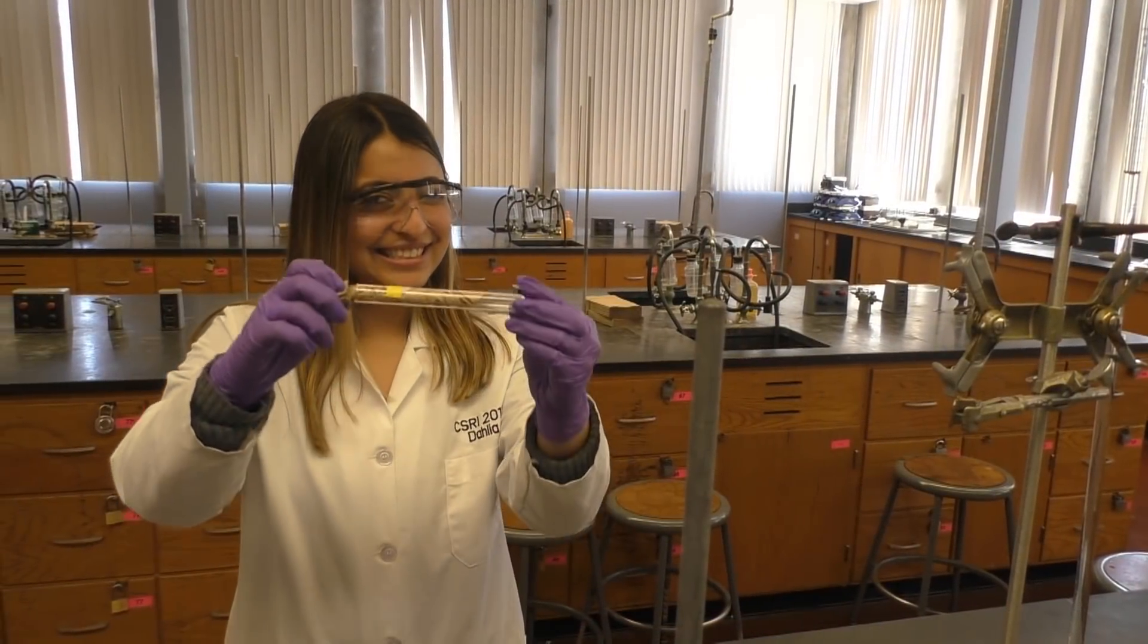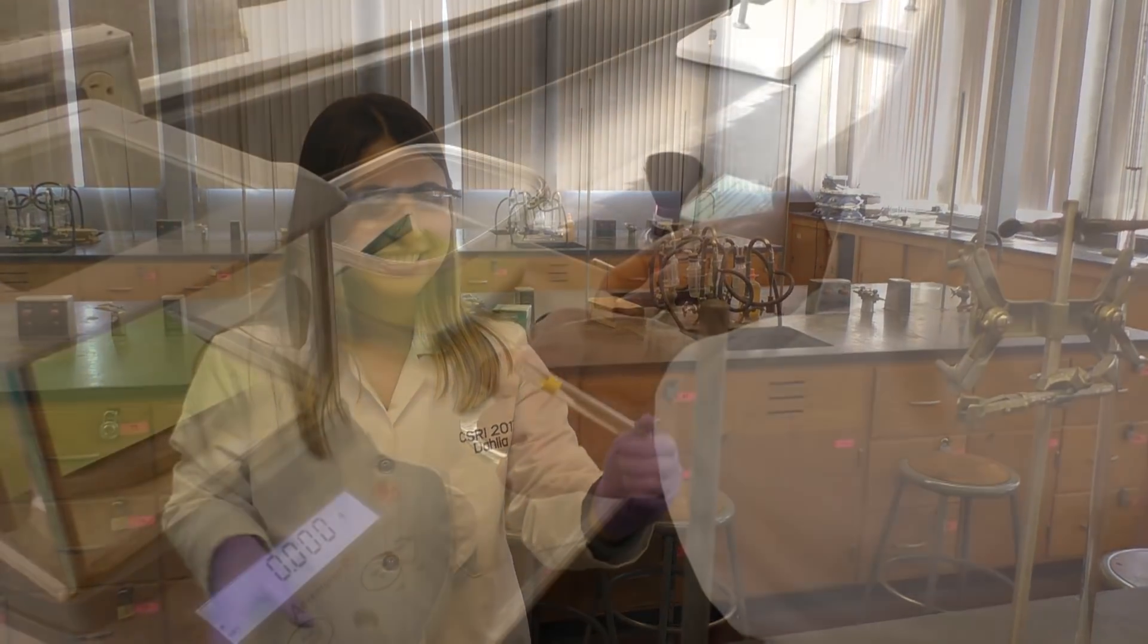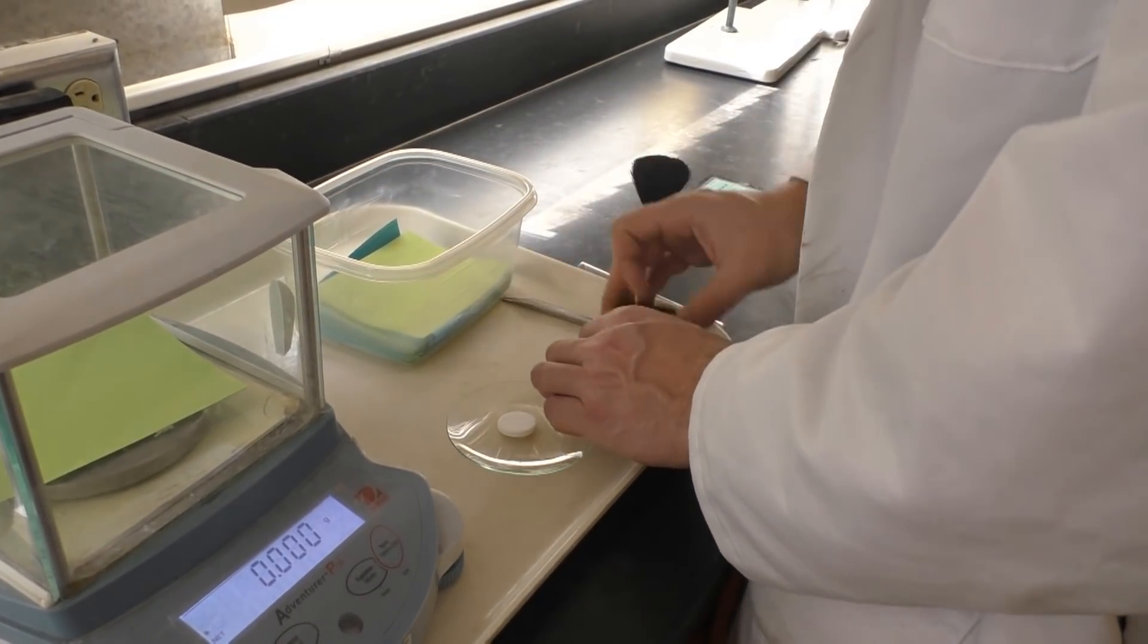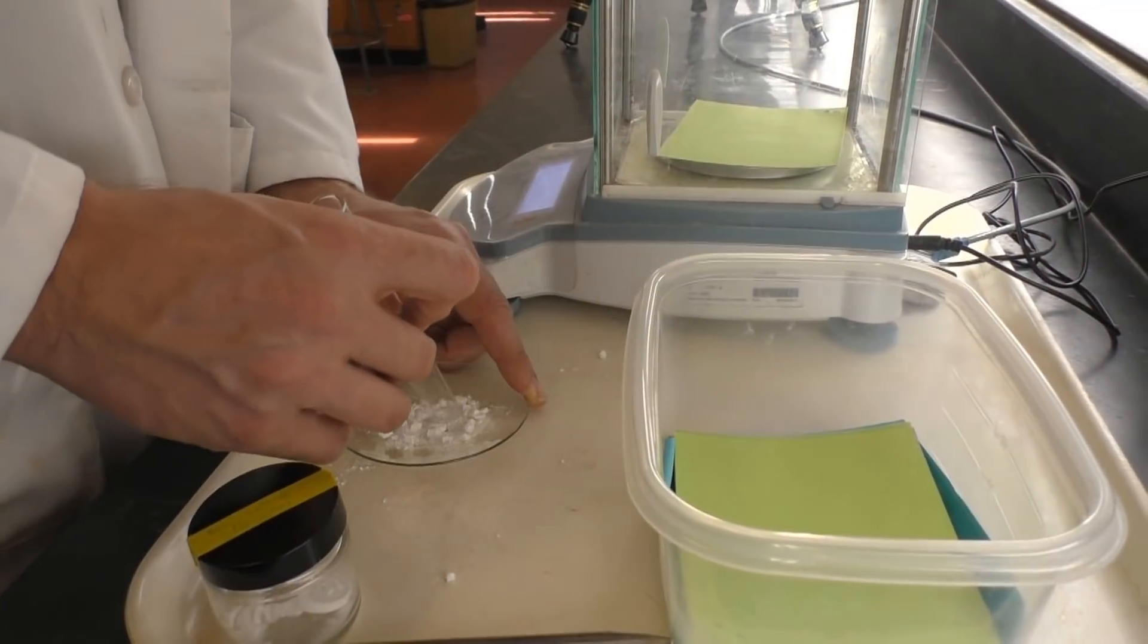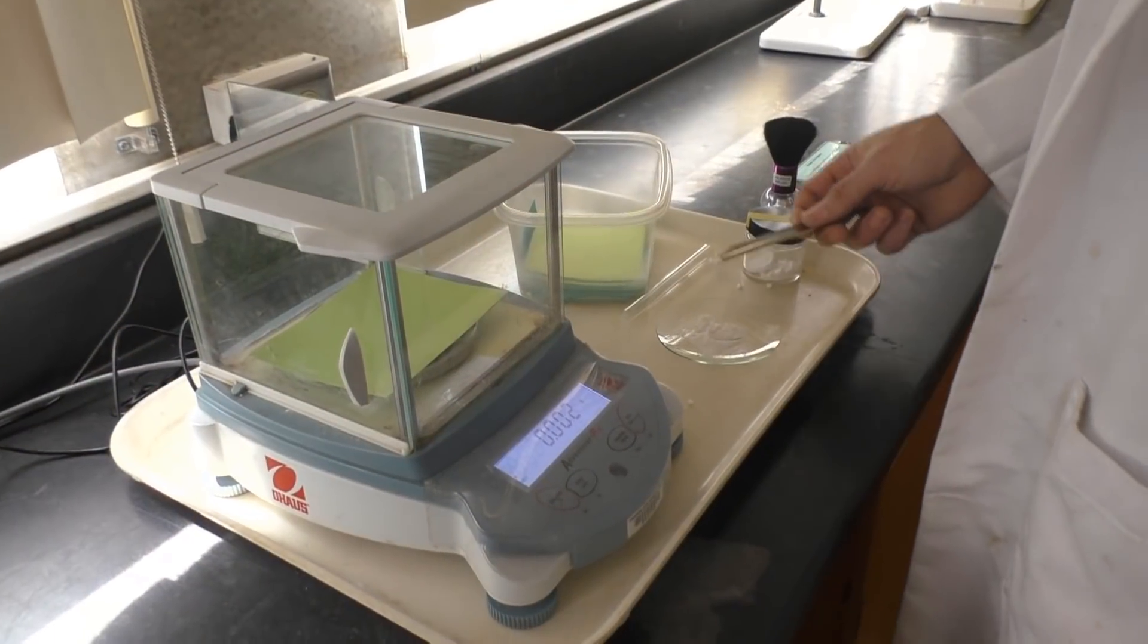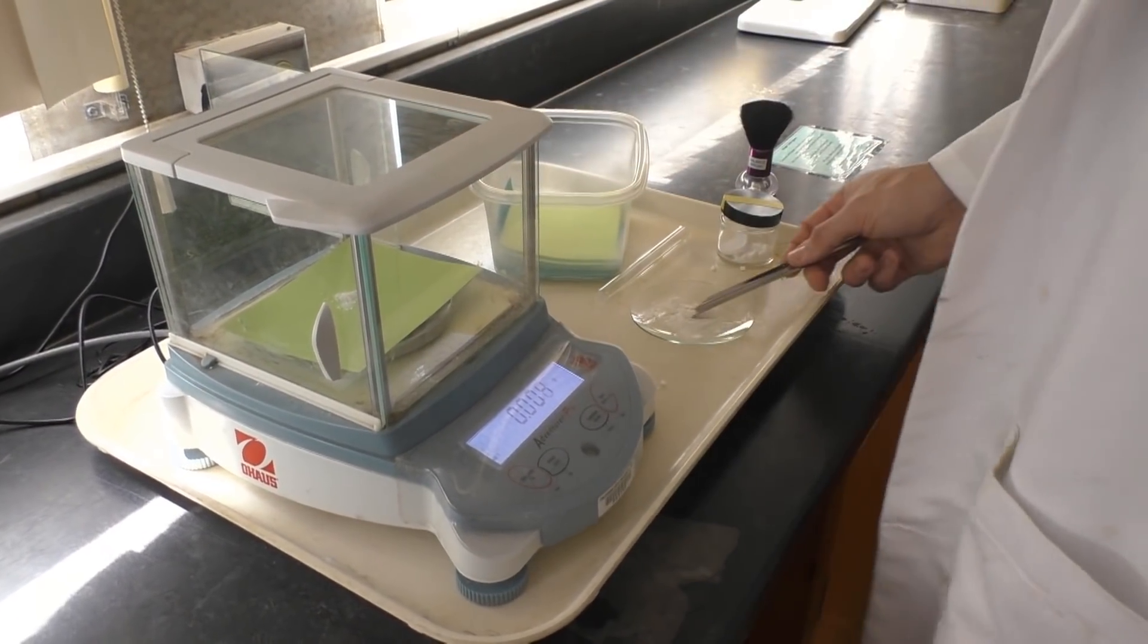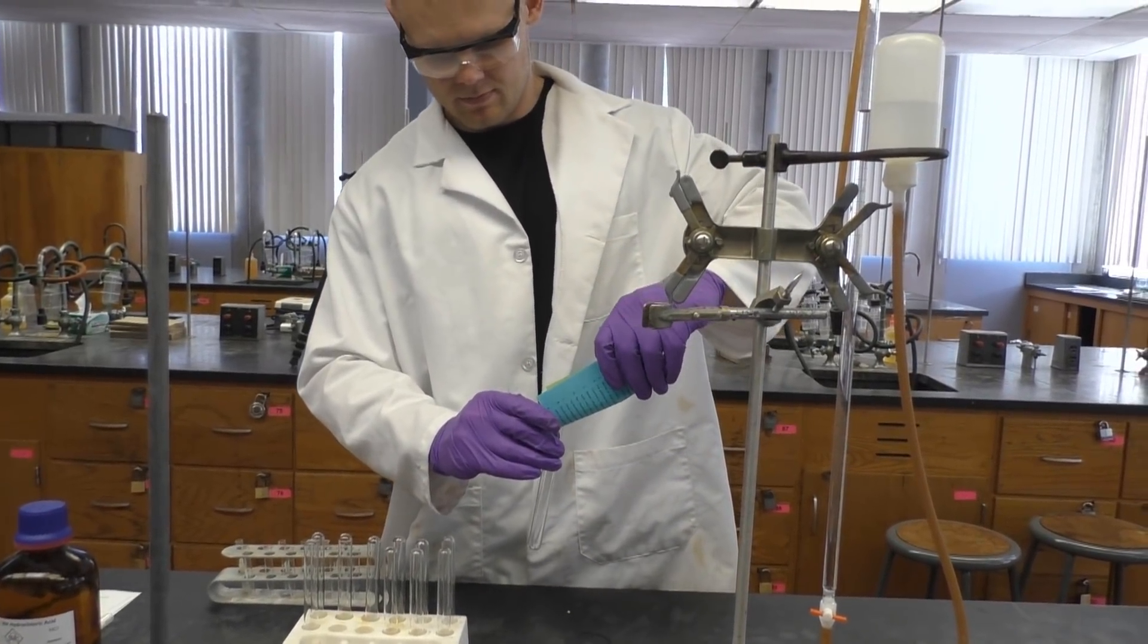You're now ready to prepare your reaction chamber. First, make sure your 6 inch test tube is completely dry. Next, weigh out about 0.1 to 0.15 grams of an Alka-Seltzer tablet. Make sure the sample is ground up well. Now add the sample to your large test tube.